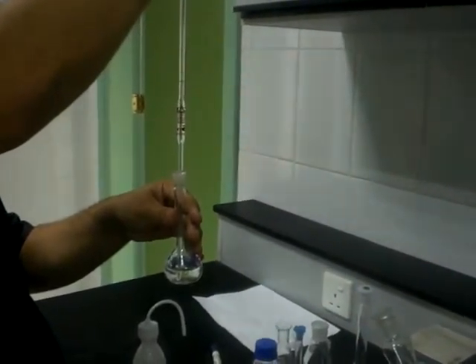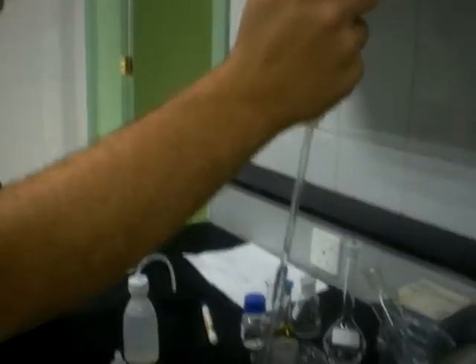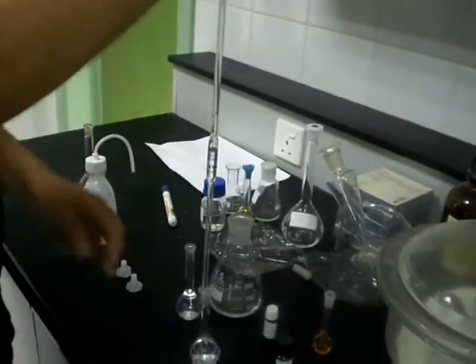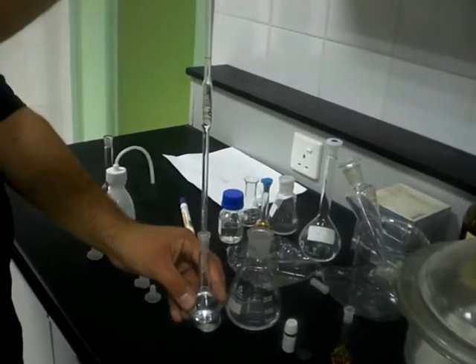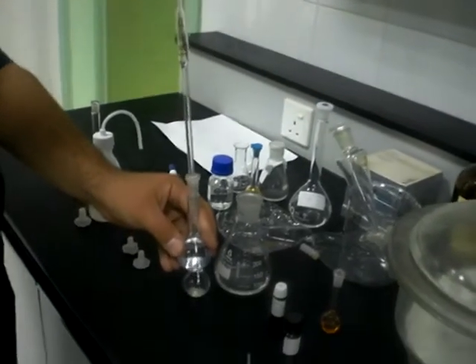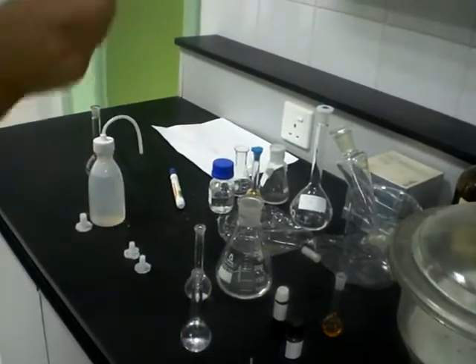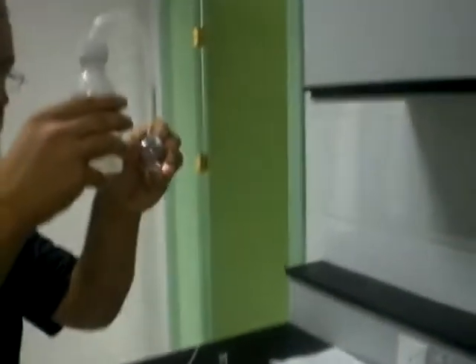In this case, we have the internal standard, which is here carvone solution, in constant concentration in each flask. Then we adjust the volume of the test and standard flasks.